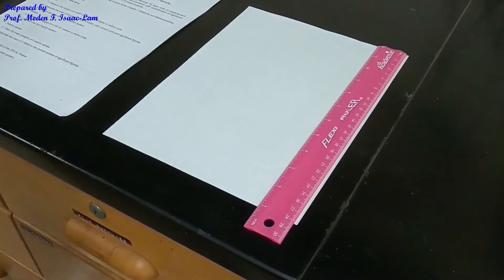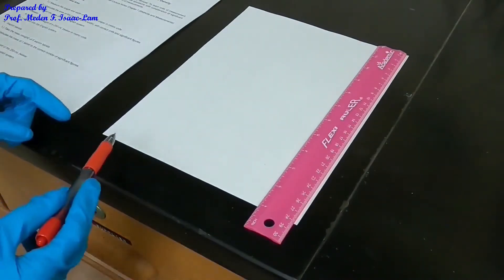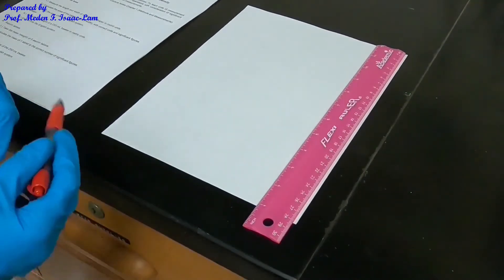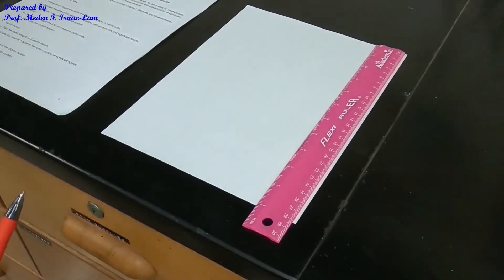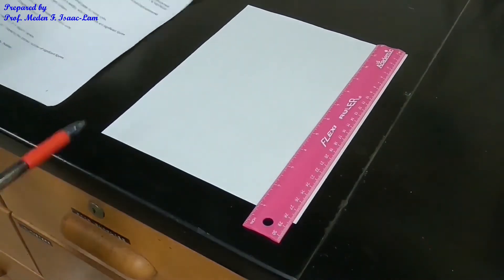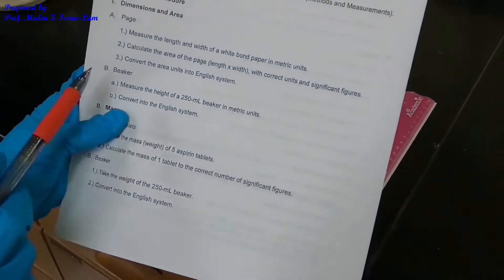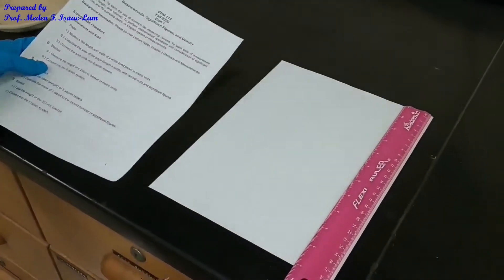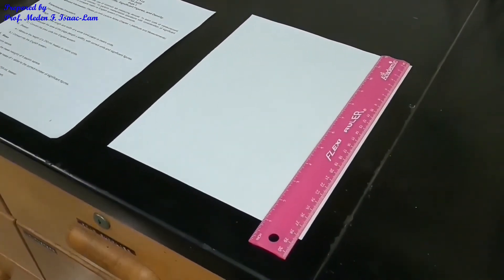Then you are going to calculate the area of the page, which is length times width, and write the correct units and significant figures. Number three, following this procedure, you're going to convert the area into units of the English system. That's it for part A, which is the page.